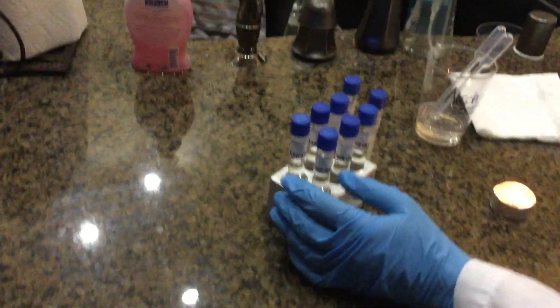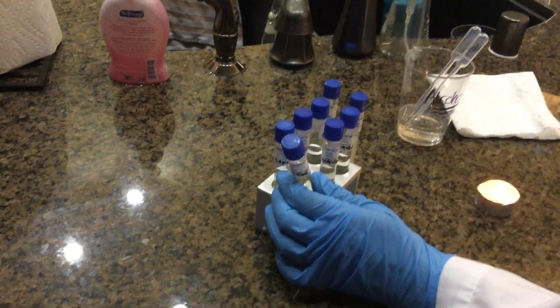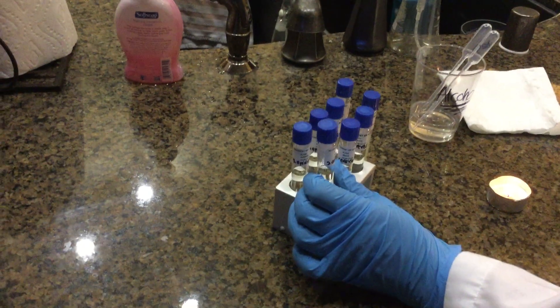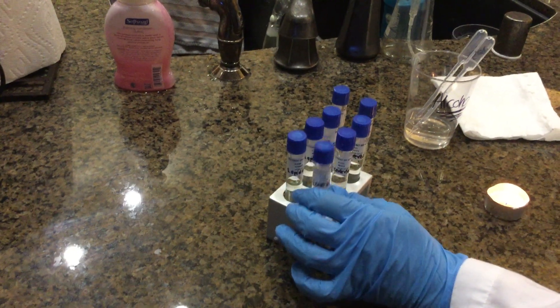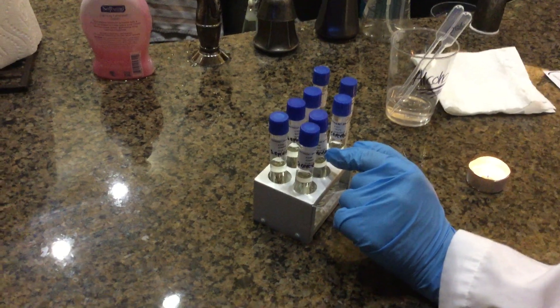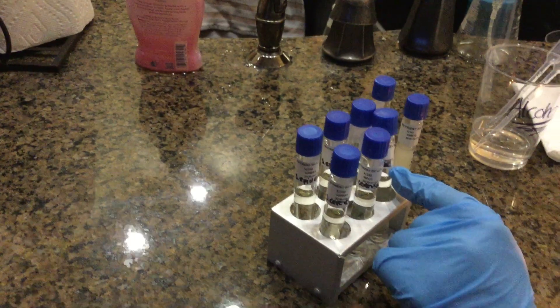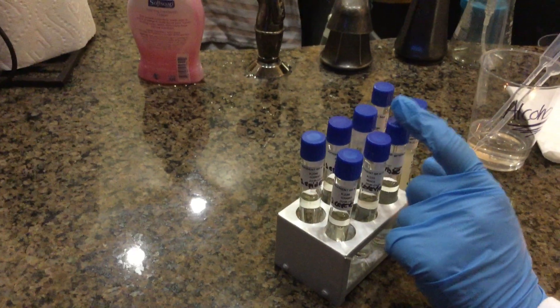Right now we're doing the salt tolerance testing. We have three different kinds of sodium chloride broth here that I already labeled. This is a 1% sodium chloride nutrient broth. This is 7% sodium chloride nutrient broth and 15% sodium chloride nutrient broth.